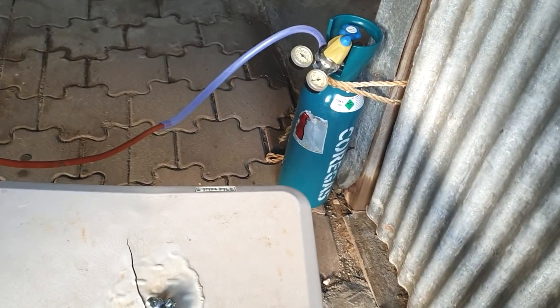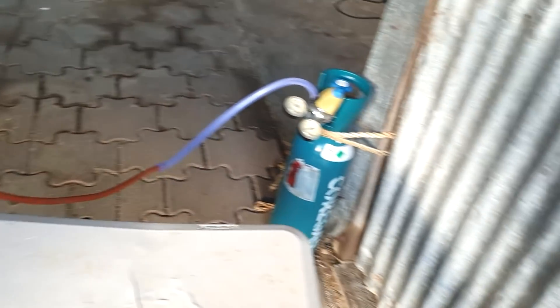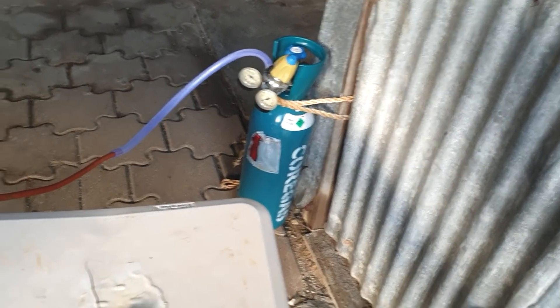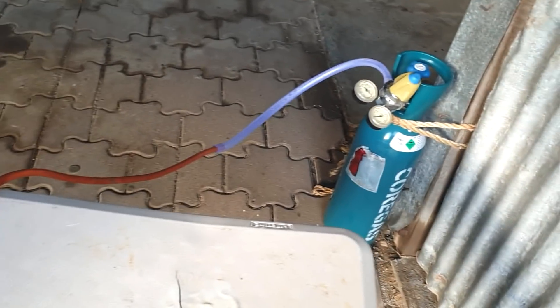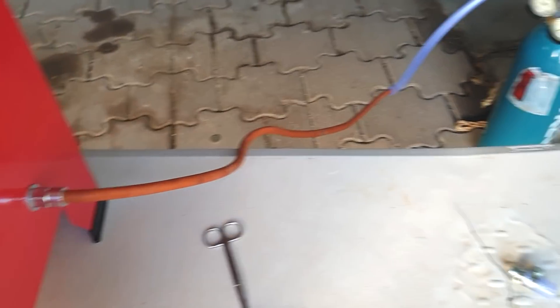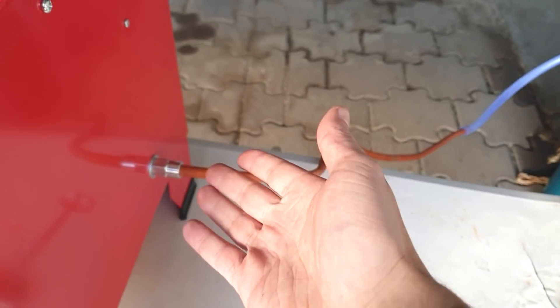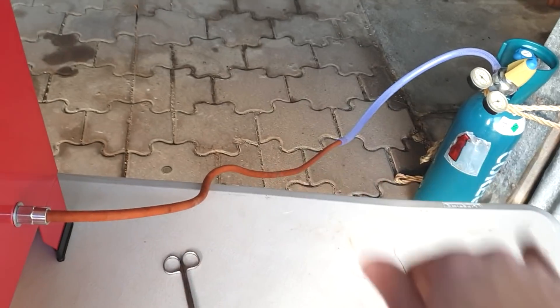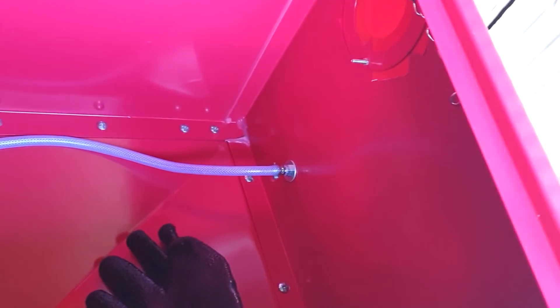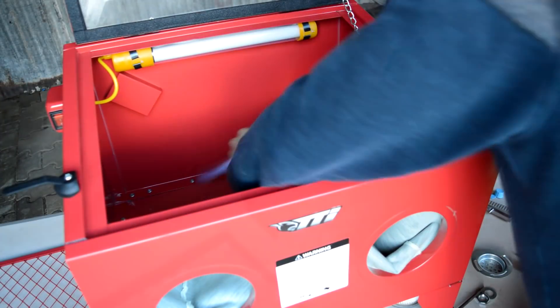I've got my regulator on the argon tied up to that wall so it's not going to fall off and become a missile. I can't find my chain and shackles so I used rope, which is not ideal. The tubing needs to be replaced with metal tubing — I'm not sure if the fittings will be cross-threaded between the air fittings and the argon. I've just taped over the holes. I brought red tape specifically so it wouldn't look so bad. These holes are pretty big, but it's actually not too bad a seal for the moment.